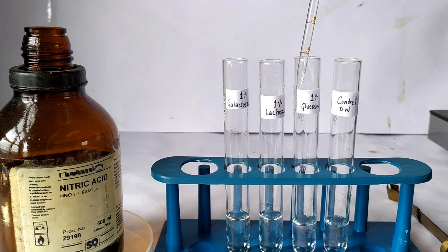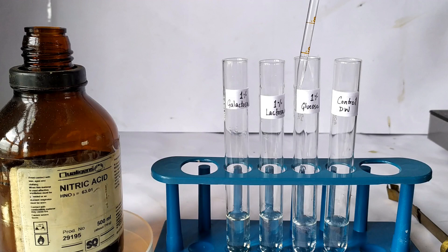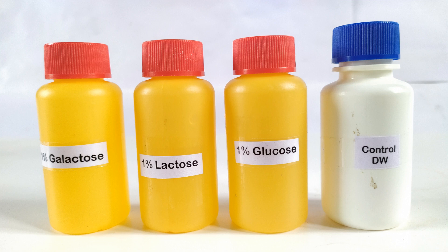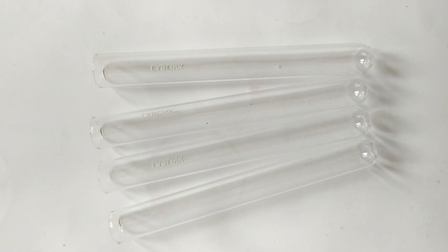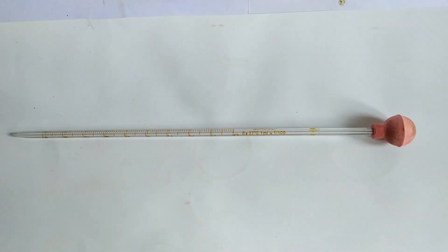In this video, we'll be performing the mucic acid test using a galactose-containing carbohydrate sample and a galactose sample. To perform this test, we'll need the following: concentrated nitric acid; test samples consisting of 1% aqueous solutions each of galactose, lactose, and any other carbohydrate sample that doesn't have lactose or galactose in it, such as glucose; and finally a control sample of distilled water; 4 identical test tubes; a test tube stand; 4 graduated droppers or pipettes of 5 or 10 ml capacities; 1 graduated pipette of 1 or 2 ml capacity with a pipette bulb; and a water bath.